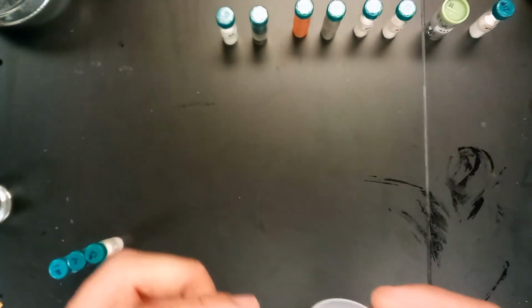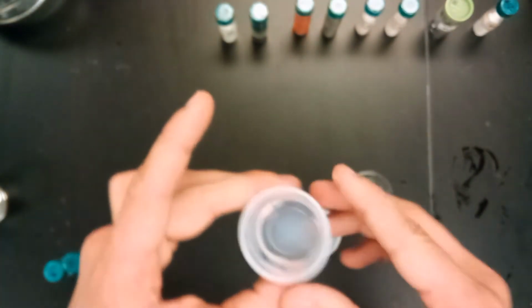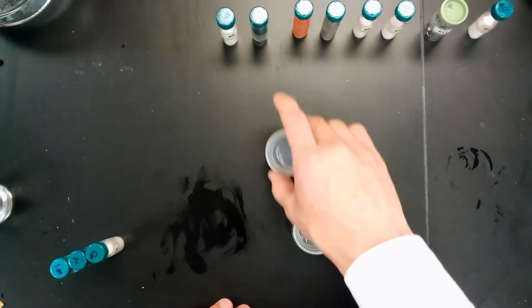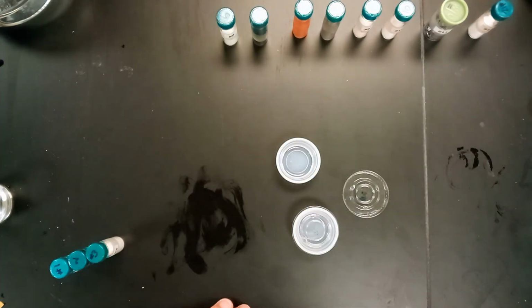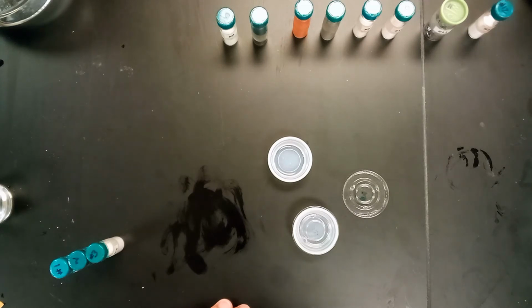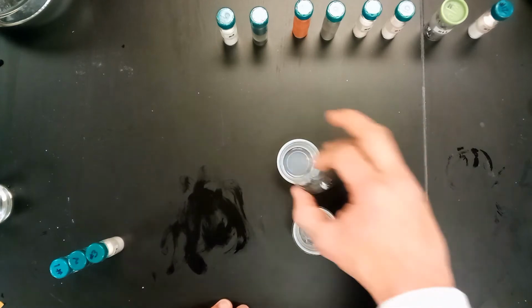This is number 4. This is much different than the other ones that we've been seeing before. I'll remove the lid a second, but this is a liquid of sorts. So one of the things to think about with the liquid is this has an extremely low melting point. This is room temperature, probably about 21 to 23 degrees Celsius, and number 4 here has melted, or it's become a liquid. So that's pretty much the only clue that we really need for number 4. It's just a liquid at room temperature, with an extremely low melting point.